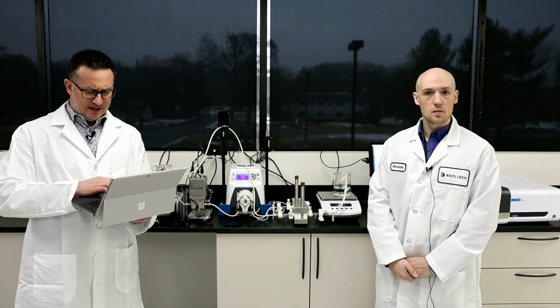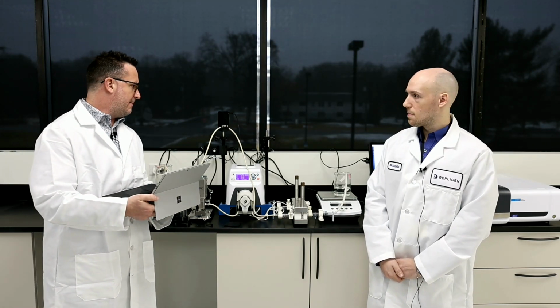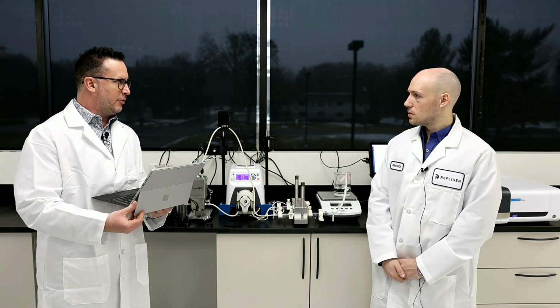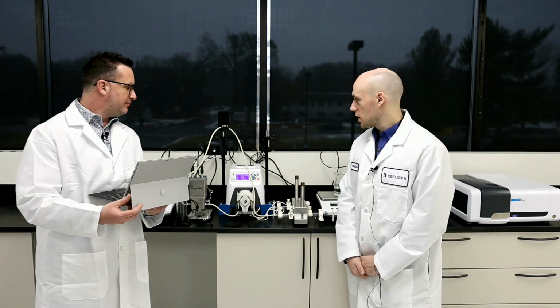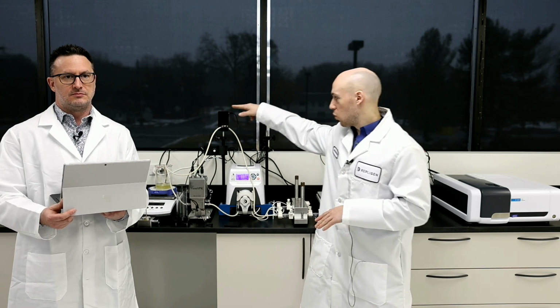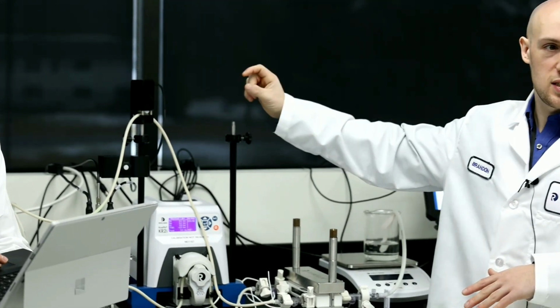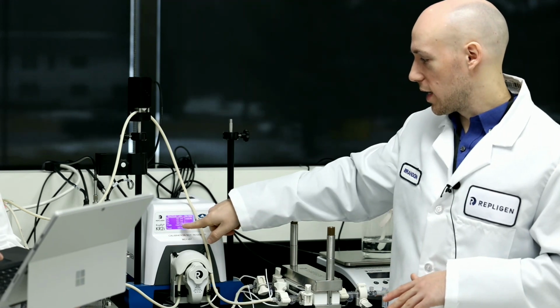And then lastly, I see there's a question here about the back pressure valve, and if you can use it to help control your TMP, and at what point do you kind of saturate the back pressure valve? Yep, so actually I use the back pressure valve to control my TMP fully. In the beginning of the run, I'm going to keep it wide open, right? And I'm going to let it sense how far it has to go in closing to get to the TMP that I want.